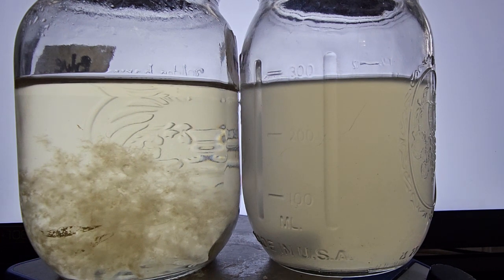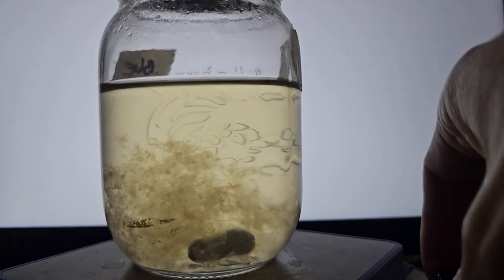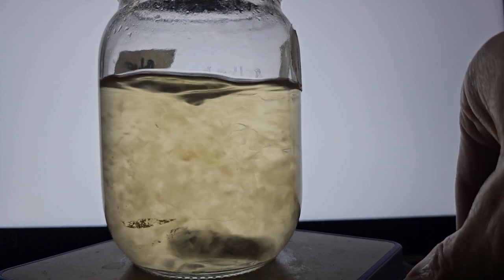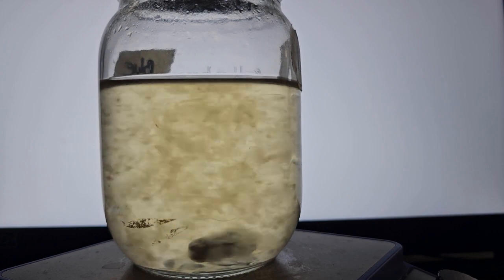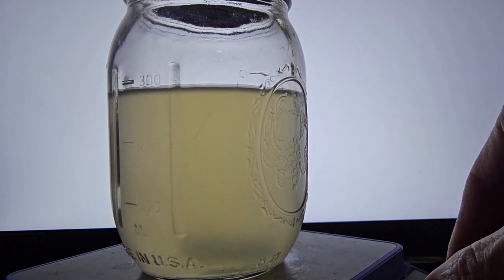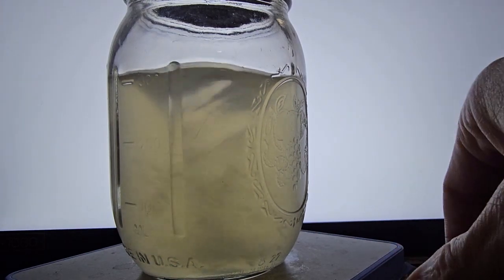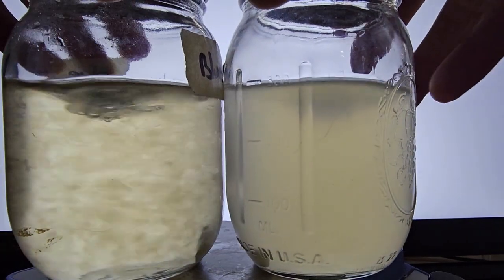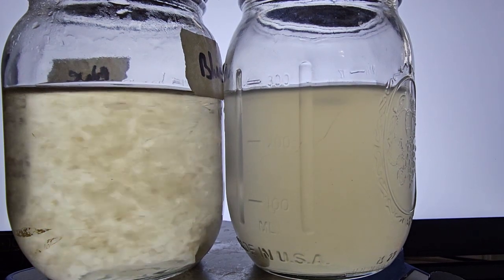So what I did in this experiment is I injected both of these with the same culture. The one on the left, you can see, is really good. This is on a stir plate right now, so I'll show you. Looking really good. Culture is beautiful, working out just perfectly. The one on the right, literally nothing growing in there at all, as you can see here. So with both of these, what I did is I cooked the one on the left 20 minutes, one on the right cooked for 30 minutes.